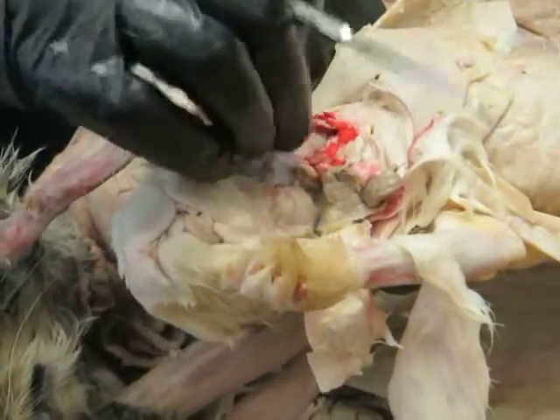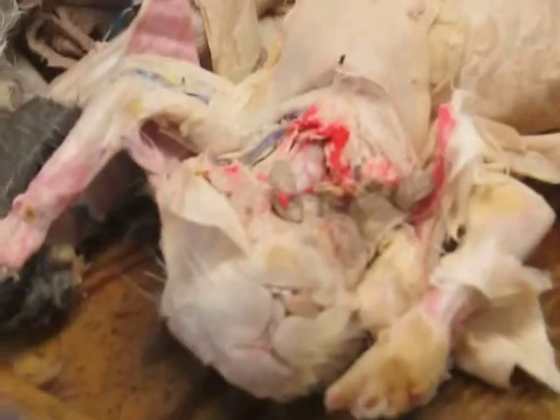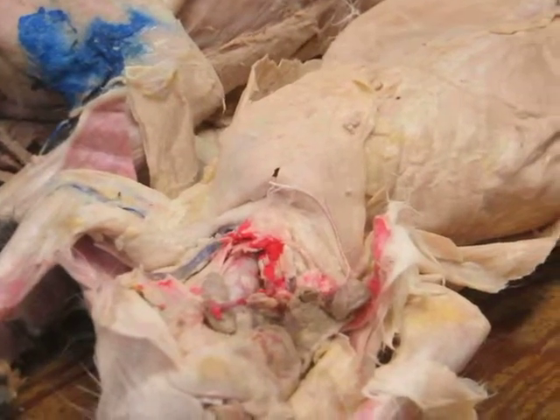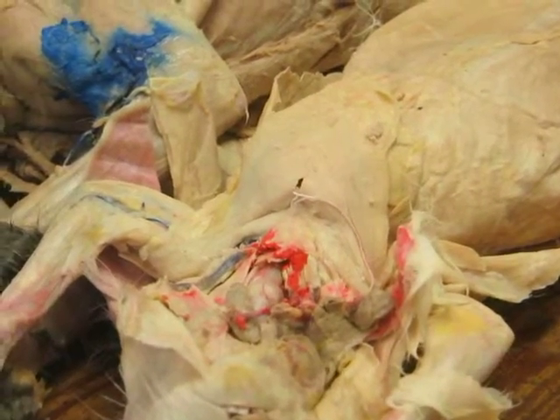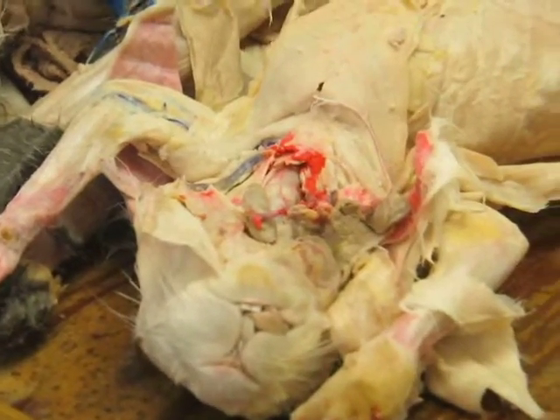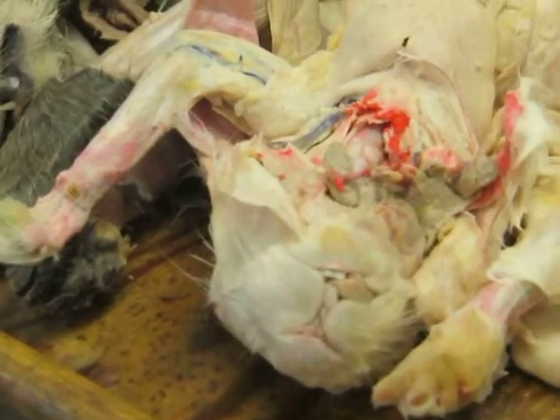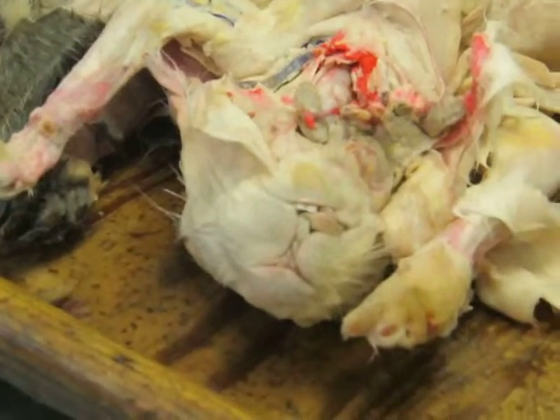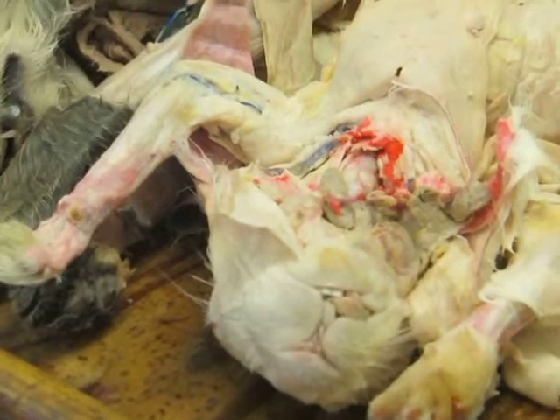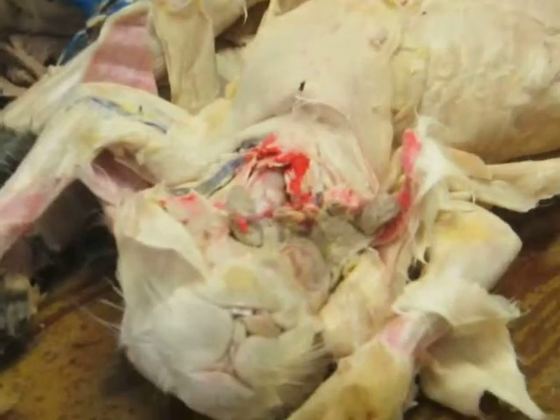There's one other muscle that we're not going to see well because the top of the head has not been skinned off in this rabbit or cat. That's the temporalis, and that's the one that comes off the temporal fossa and arises there. It has fibers that extend down under the zygomatic arch through that gap created below the zygomatic arch, and insert onto the coronoid process of the mandible. And again, part of the jaw closing musculature, temporalis and masseter are the main jaw closing muscles. And that one is much better developed in carnivores. So the cat has a pretty good temporalis, the rabbit has a very small one.